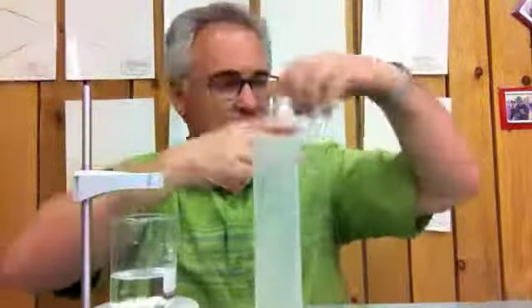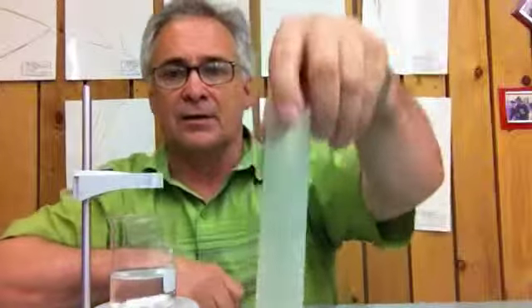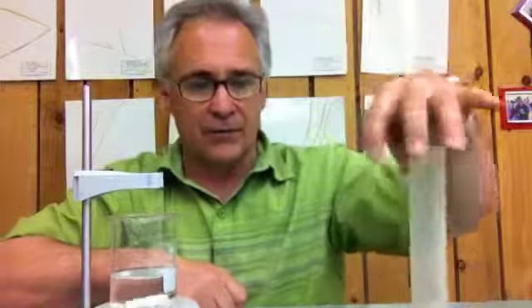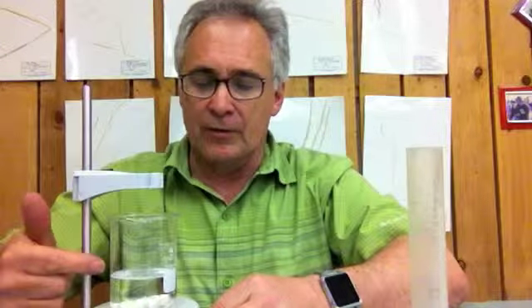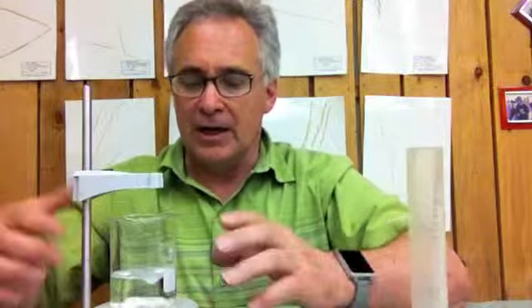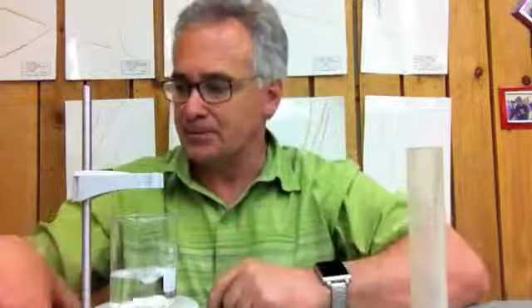All right, so now what I've done is I've gotten my 10 mLs of vinegar and my 100 mLs of water in a 200 to 400 ml beaker. I have it on a stir plate with a magnet on the bottom. But what are we going to measure?